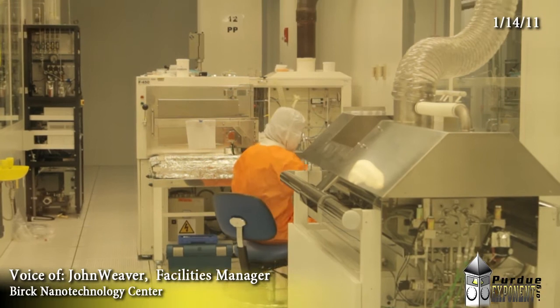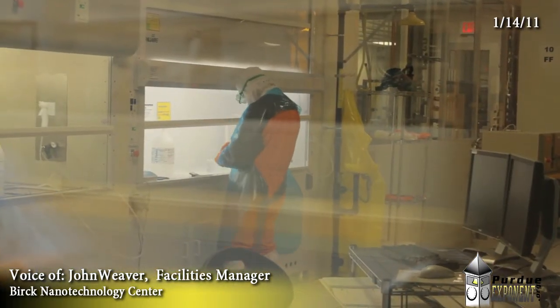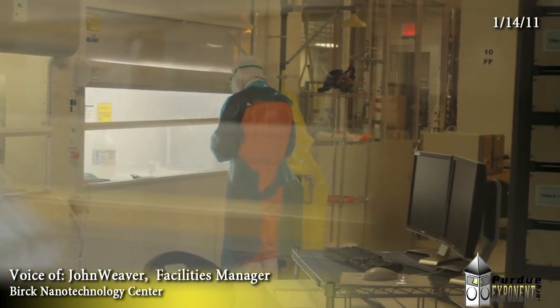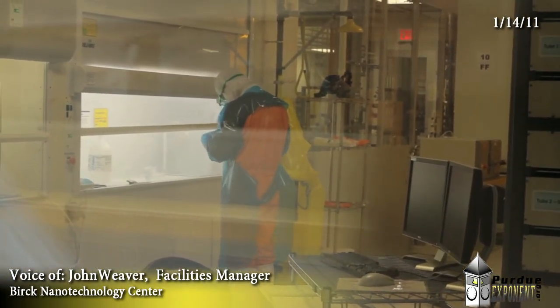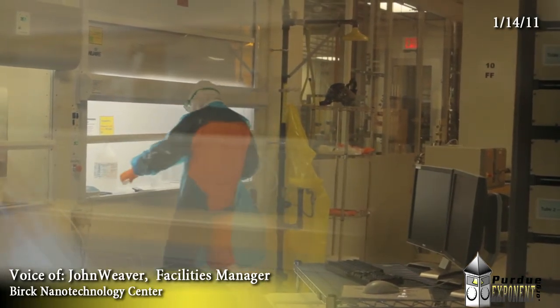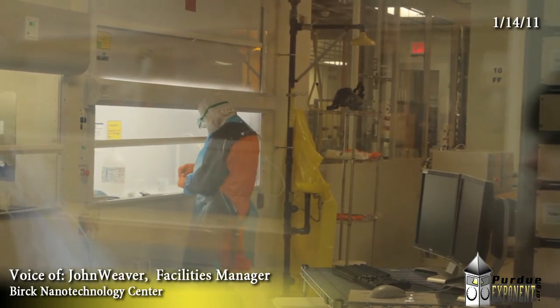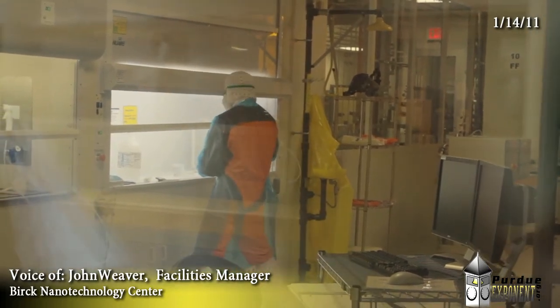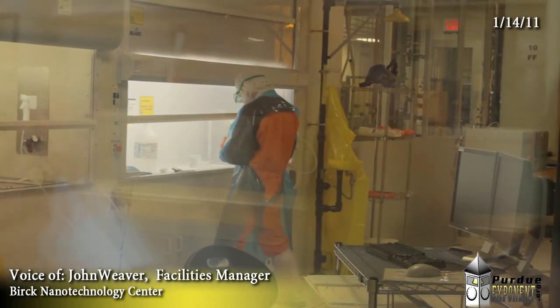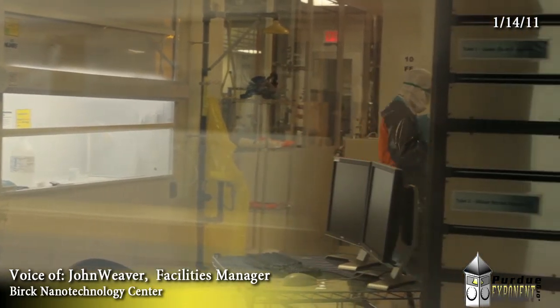The second mechanism is more chemical. Every particle has some kind of a chemical signature — it's made of something chemical. So when you put that in one of these reactors, especially if you heat up the reactor, you can actually create a chemical reaction that will confound the research. What we're trying to do is eliminate any outside interference to the research so that we have a high level of confidence in what is actually happening.